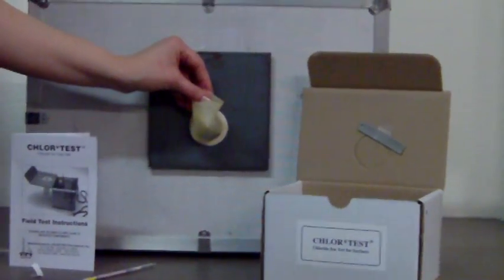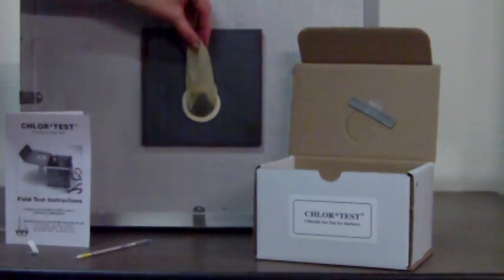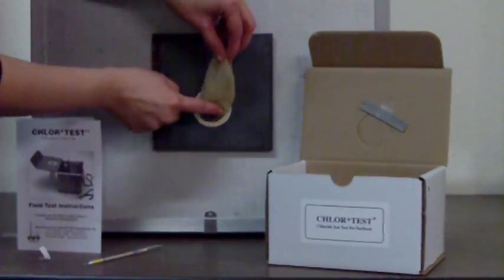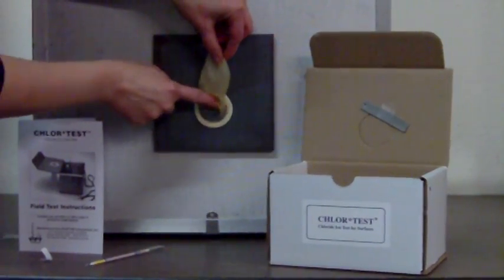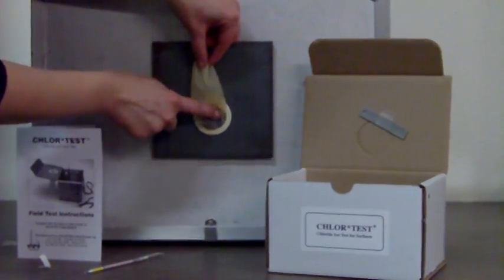Lift the sleeve from the bottom so the extract runs against the steel surface. You massage that with your fingertip and you massage it for two minutes. We suggest you use a watch with a second hand. Two minutes is actually longer than you think it is.